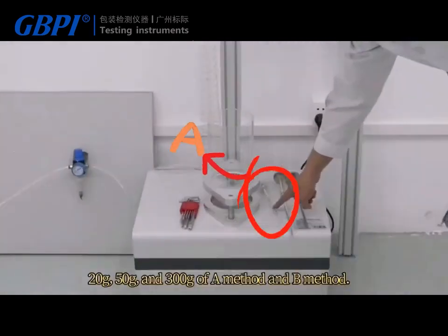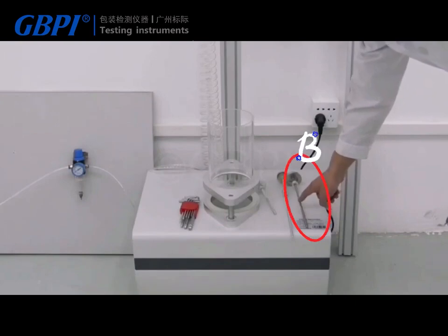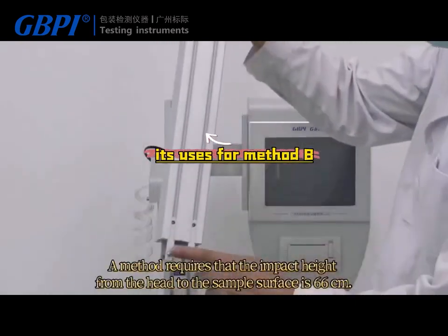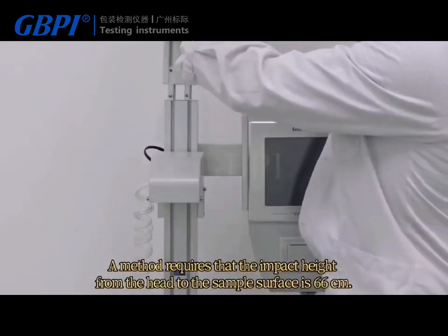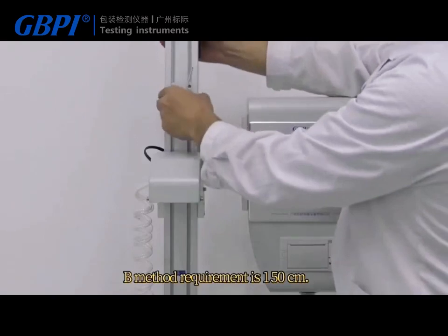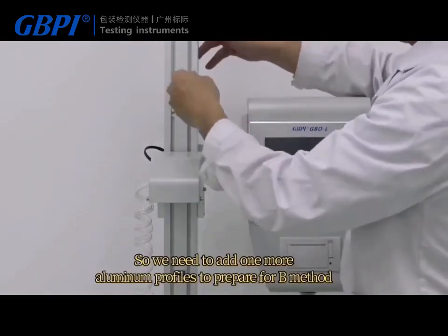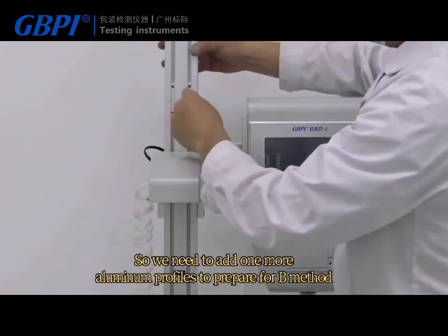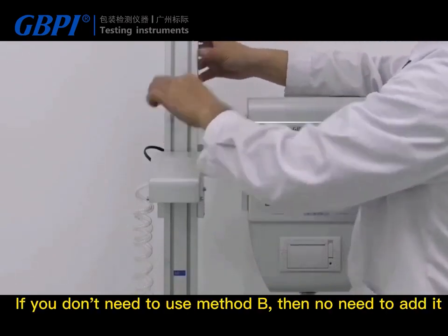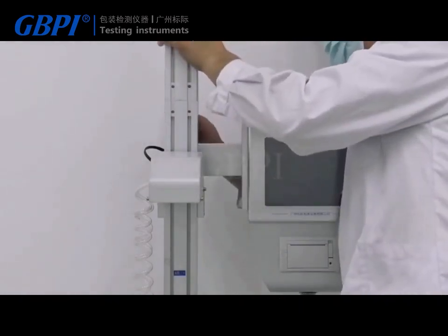The test uses 20G, 50G, and 300G for Method A and Method B. Method A requires that the impact height from the head to the sample surface is 66 centimeters. Method B requires 150 centimeters, so we need to add one more aluminum profile to prepare for Method B. If you don't need to use Method B, there is no need to add it.